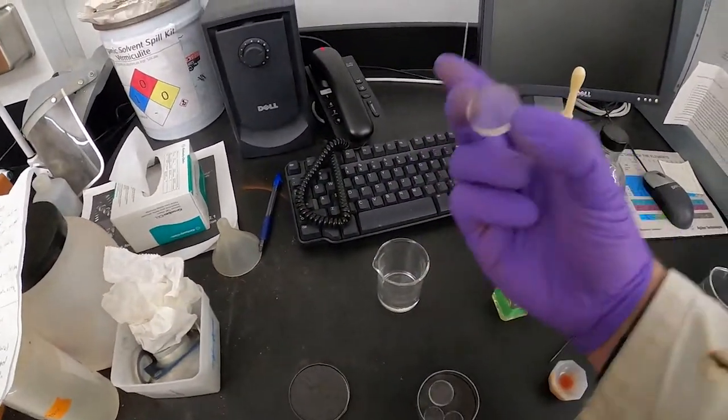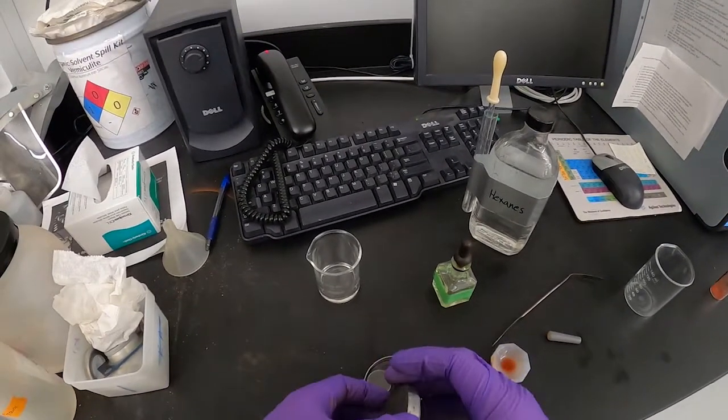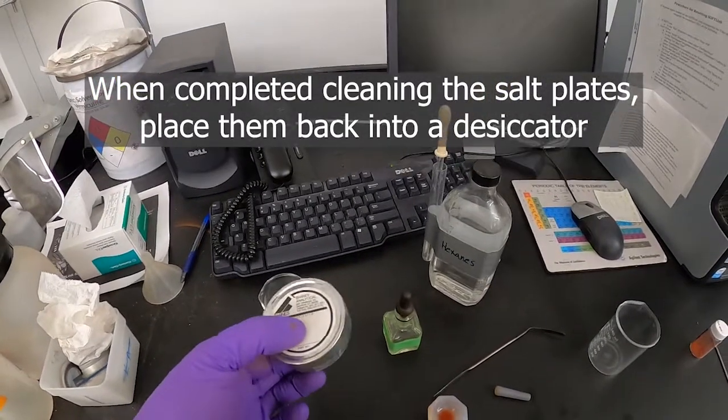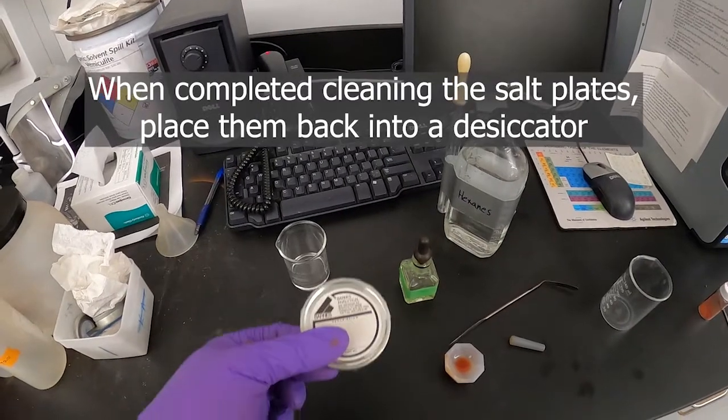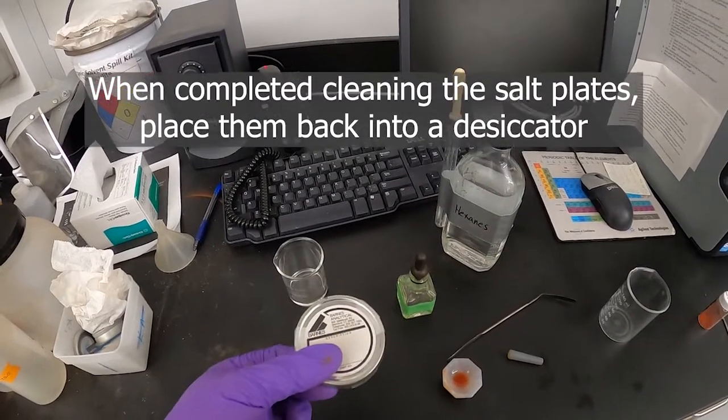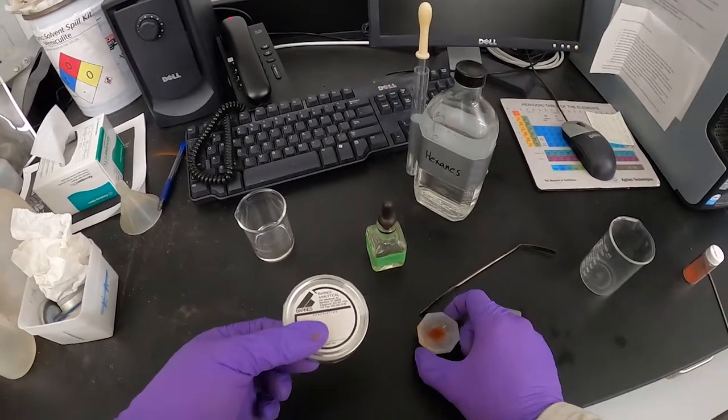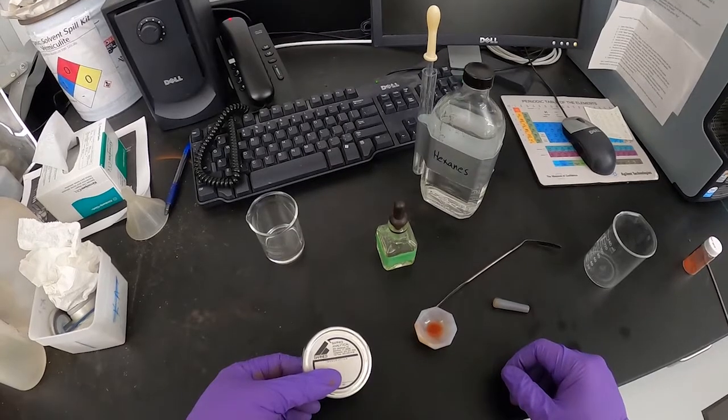To avoid scratches, it's important that we don't rub the plates with anything. That's why we just rinse them and put them back in their container. Then you would want to put this in a desiccator to store them so they last longer. That's all for Nujol.